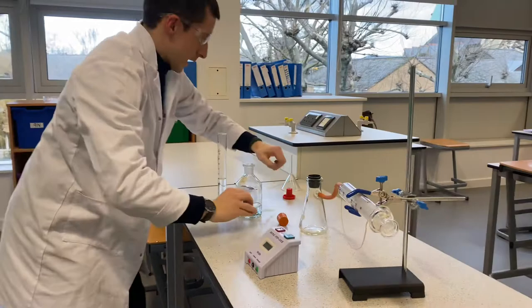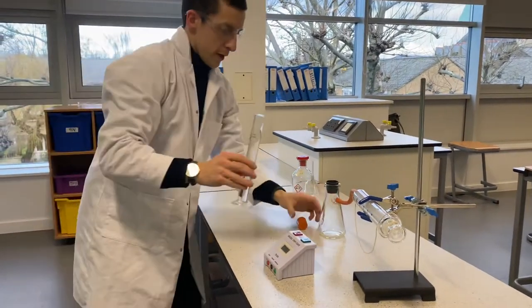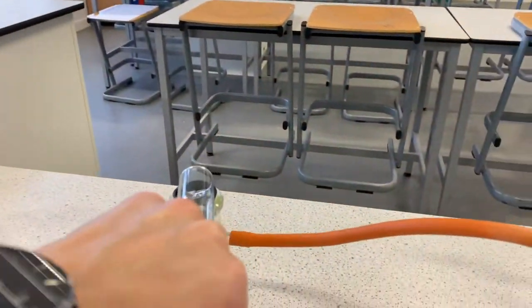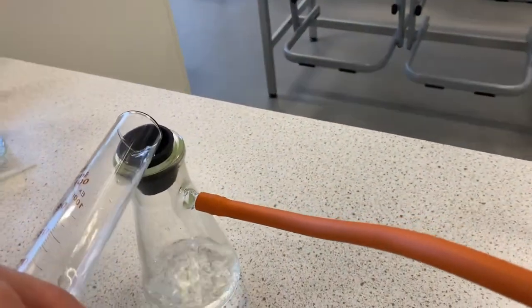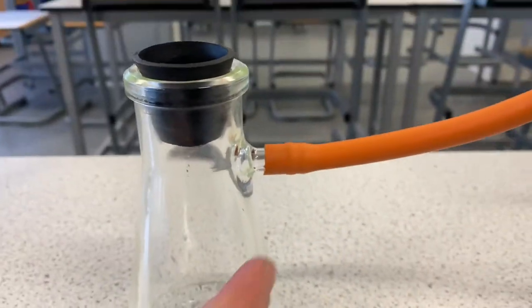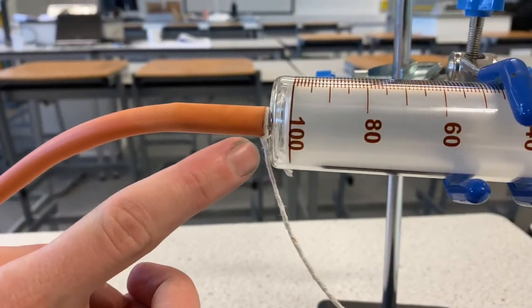And then? So I am going to take my 50 centimetres cubed of hydrochloric acid and put it into my conical flask. This conical flask is a little bit different, because as you can see on the side, it's got an arm — it's got an arm which goes to this delivery tube, which connects it to our gas syringe.